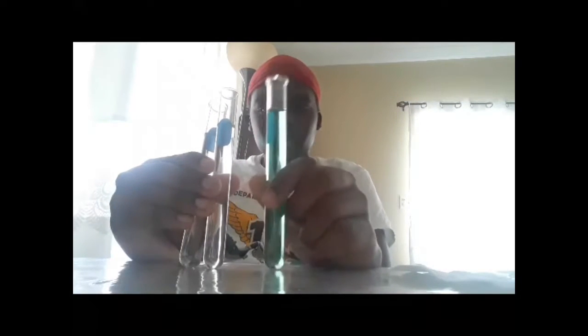And this one is rubbing alcohol, the green one, not any alcohol we drink, green rubbing alcohol. I'm going to show you all. These are the liquids I'm using. I'll put them back in their designated areas, then we'll go in order, from right to left in a line.